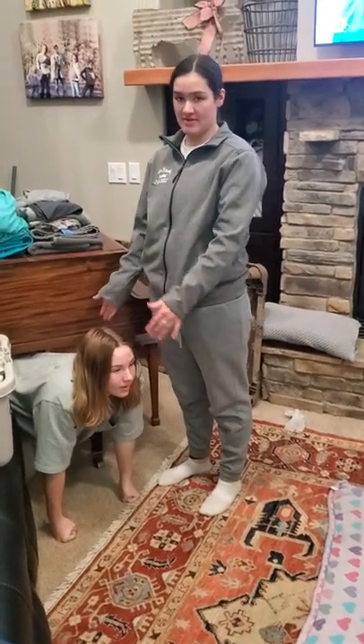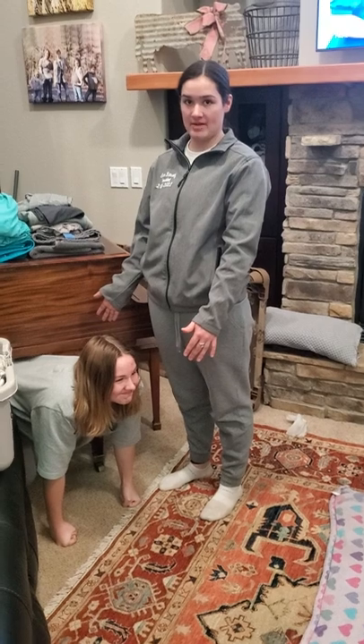Okay, this is how you restrain a rabbit. So your rabbit's in your cage. Yes, this is a very large rabbit, but we're going to make it work.